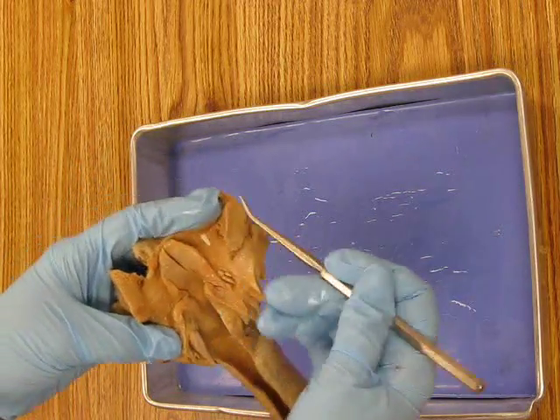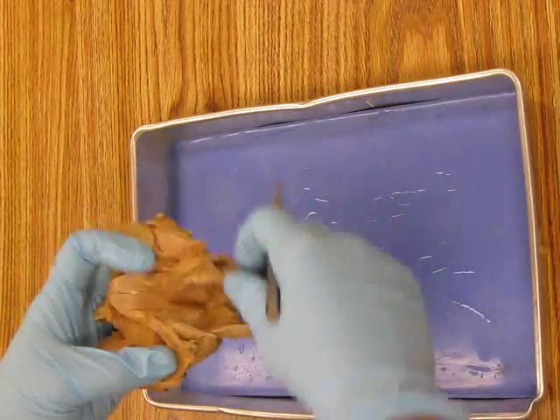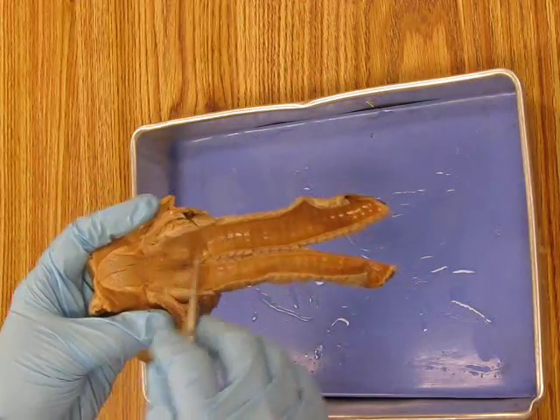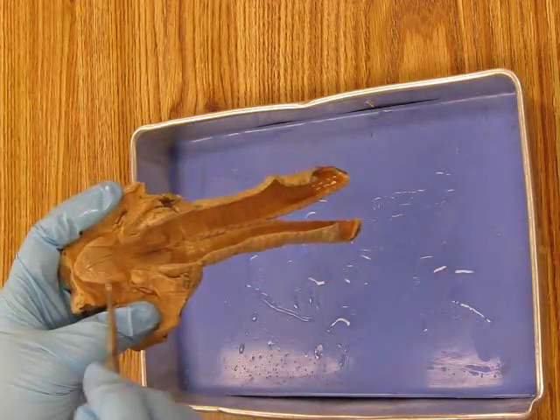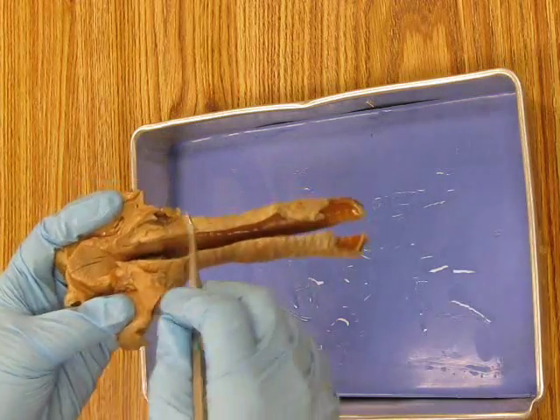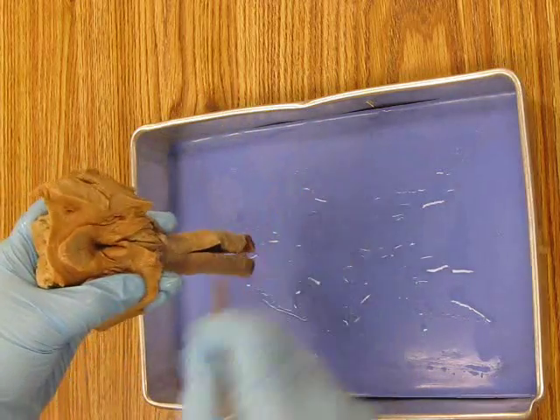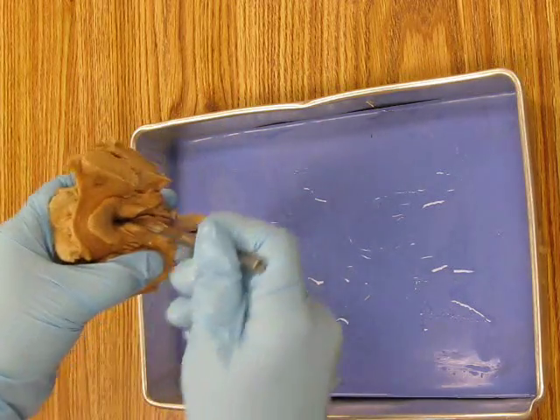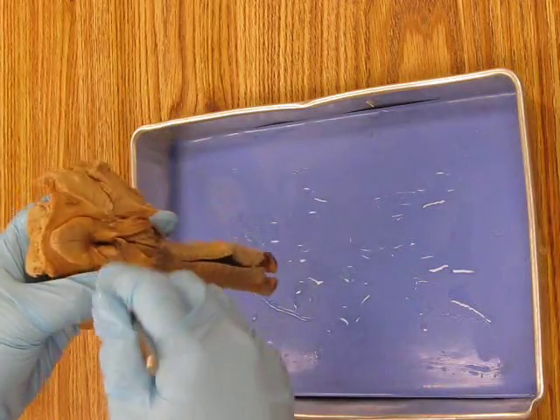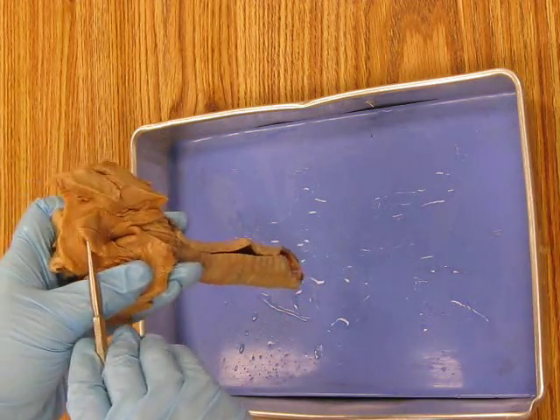Okay. And then when you look at this from the inside, this is the epiglottis. And that epiglottis, remember, is elastic cartilage that is going to fold down over the airways as we swallow. Epiglottis. Okay. Now the glottis is the actual opening to the larynx. So this opening where air would go into the larynx is the glottis, which is why this is called epiglottis, because it's over the glottis.